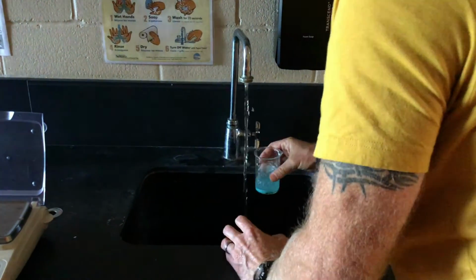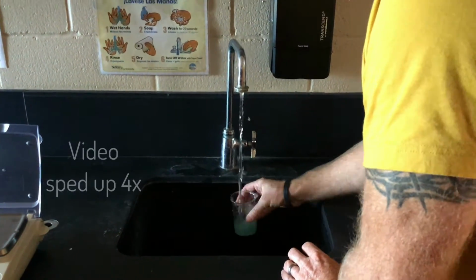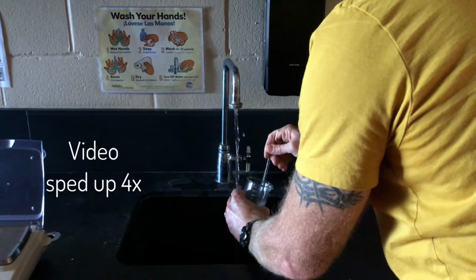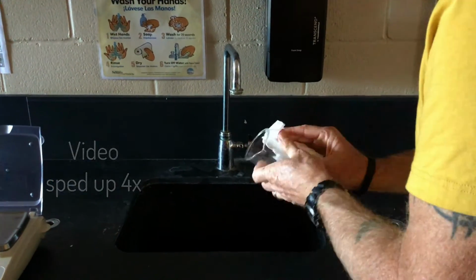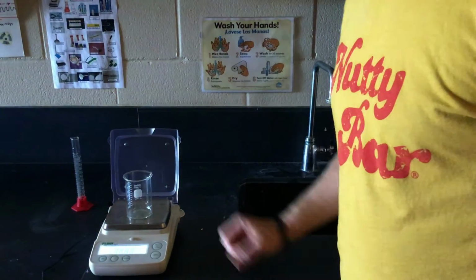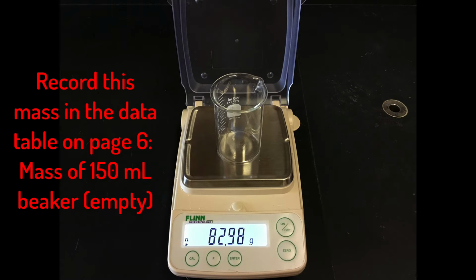Now we are going to clean out the 150 milliliter beaker containing the copper nitrate. We no longer need the copper nitrate, so we're going to rinse out the beaker and dry it really well with a paper towel. Now we're going to mass the 150 milliliter beaker and record this mass in the data table at the bottom of page 6 as the mass of the 150 milliliter beaker empty.